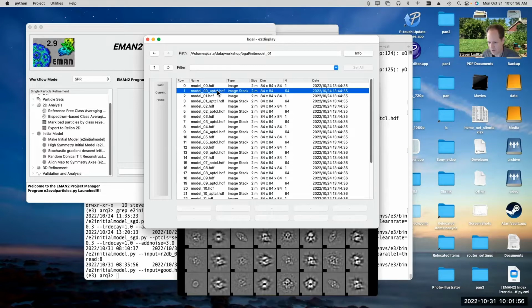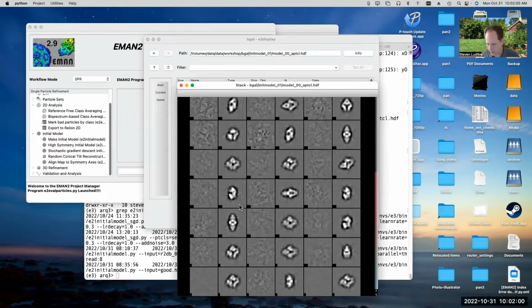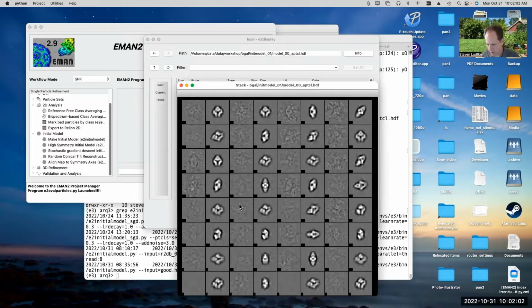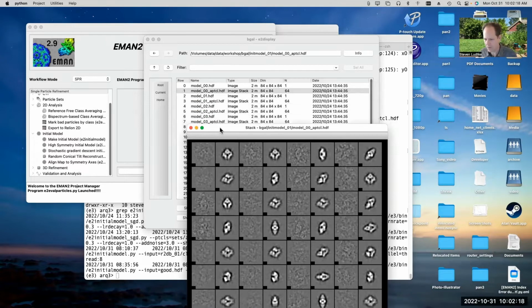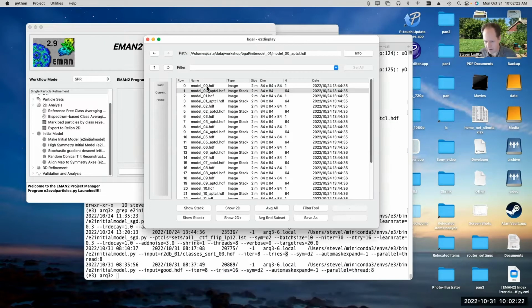Now, if we look at this, you can see it's going to show us a handful of comparisons between individual particles and class averages, but the particles are really noisy. So you can say, oh yeah, look there, and that, actually that does look pretty nice. But the particles are pretty faint, a little bit hard to see, even though they've been filtered a bit. So you may not get as much out of the particle file in this case, but we can look at the 3D map.